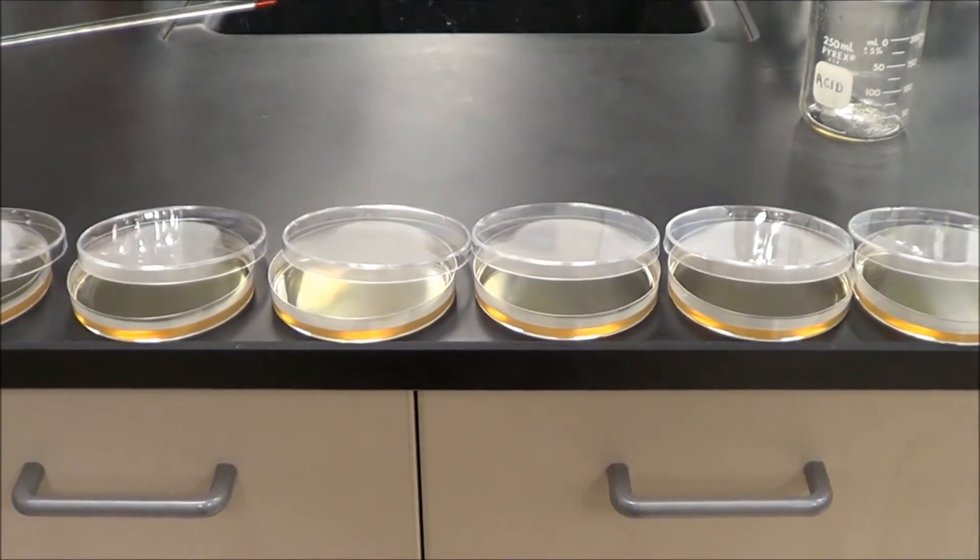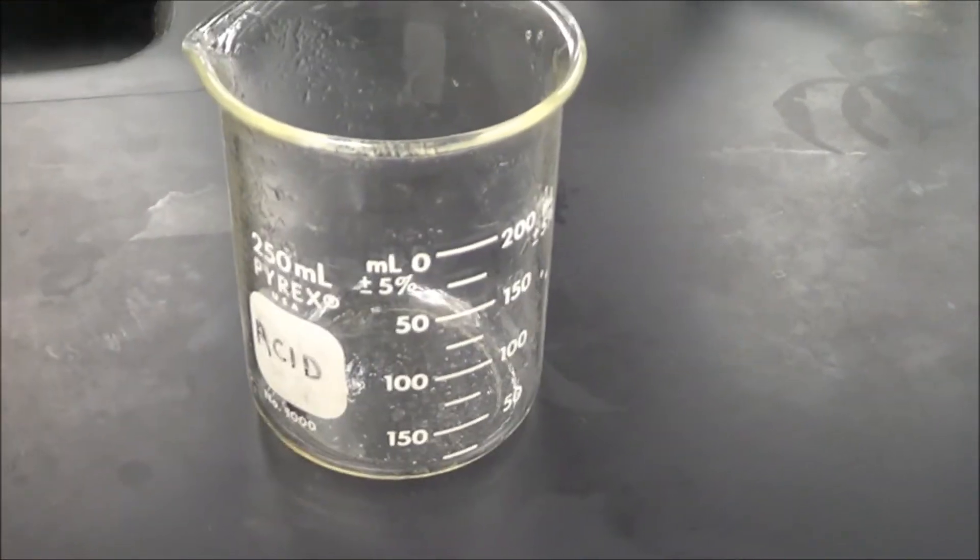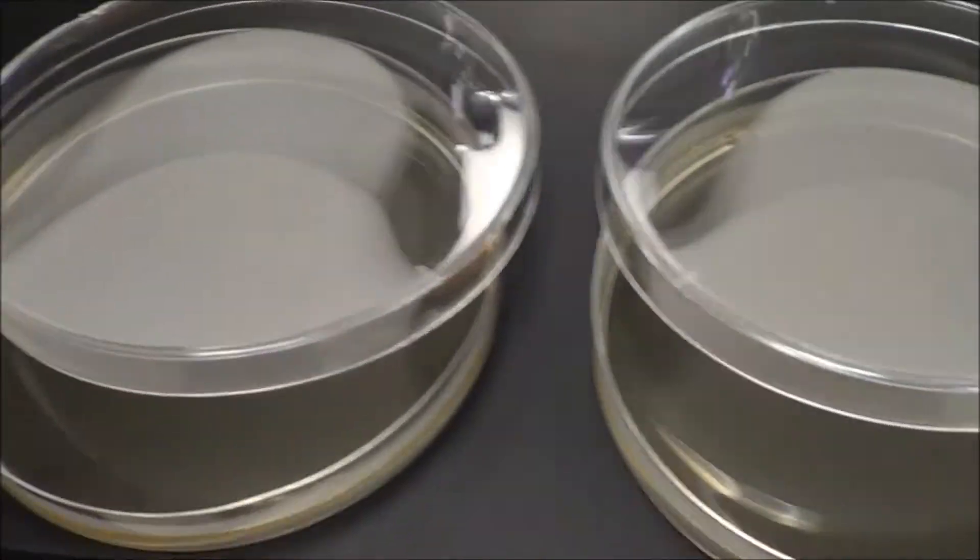Alright, 8 minutes later here, and so here's what we do. We take the agar, and it's very hot by the way, and we pour it into our sterile petri dishes here.